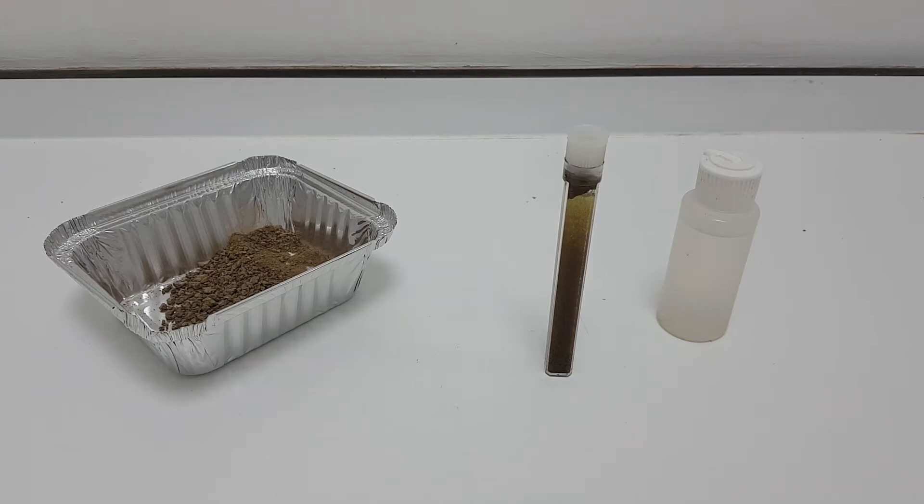Leave the test tube to stand for one minute. This is to allow the sample to settle and make reading the result easier.